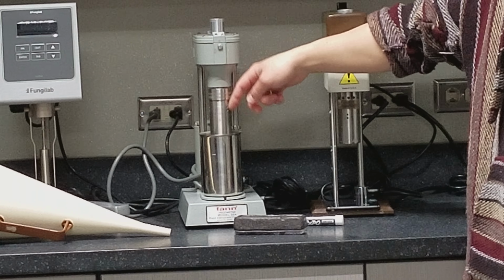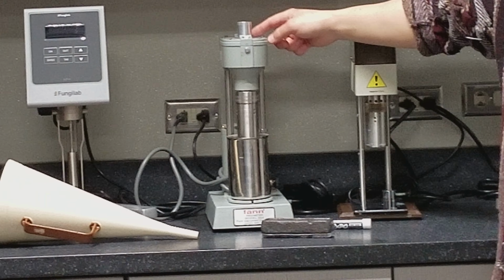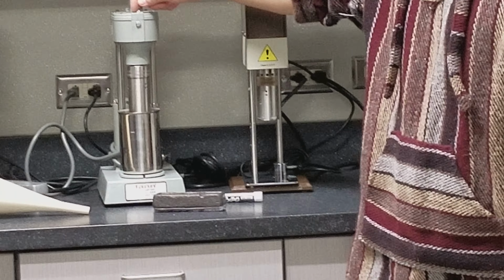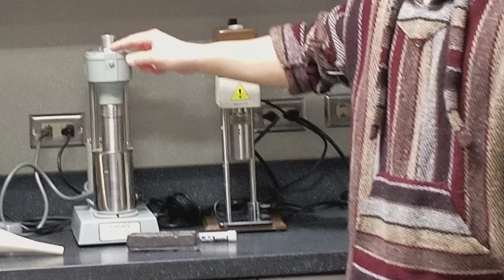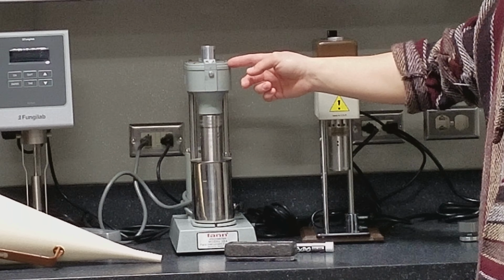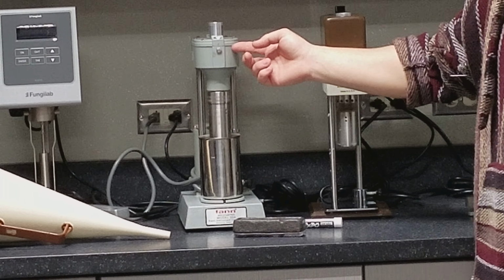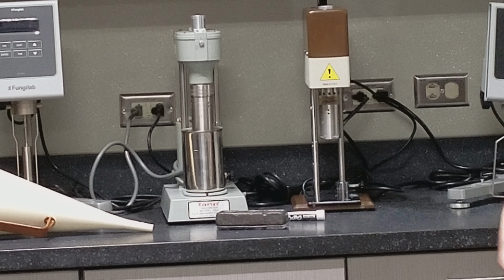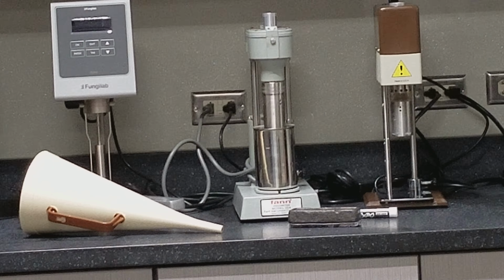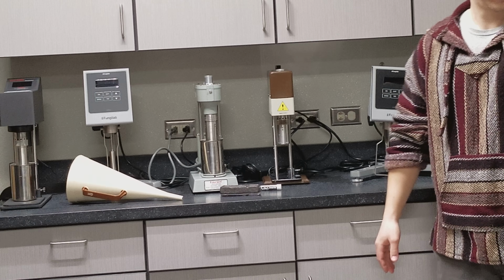Lower. Then there's several velocity settings, and you will look in this little opening here with a magnifying glass. The dial in there gives you a measurement. At different speeds, it will give you different measurements that can later be converted into viscosity. So two instruments to measure viscosity. And that will complete this experiment here.